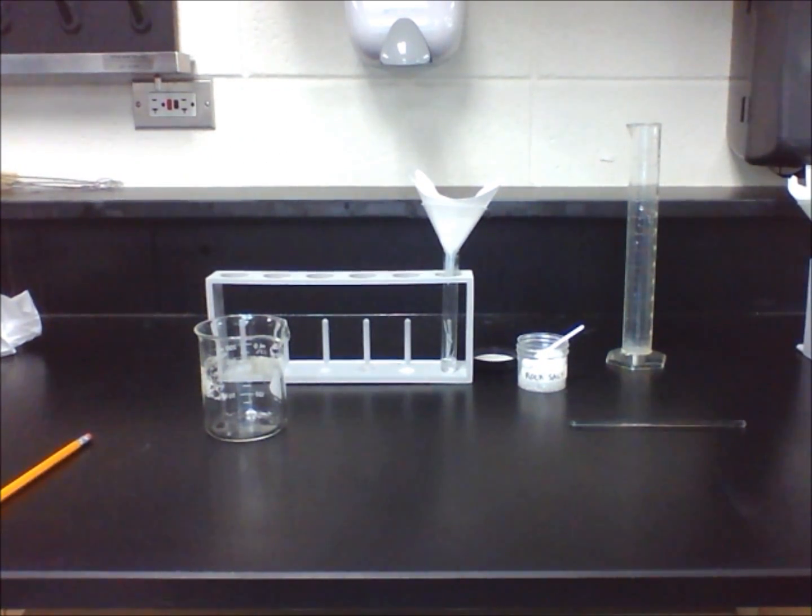After you have made a detailed step-by-step procedure of how to clean rock salt, perform the experiment and observe what happens.